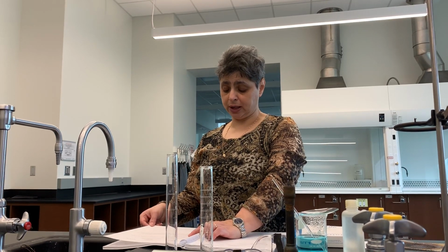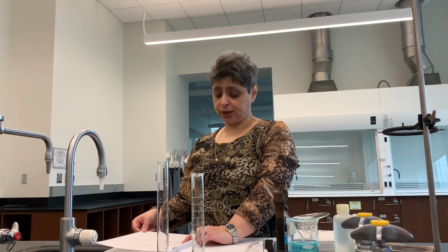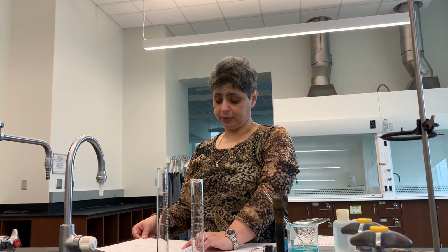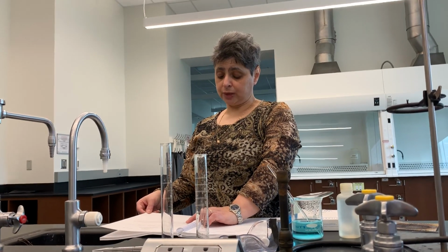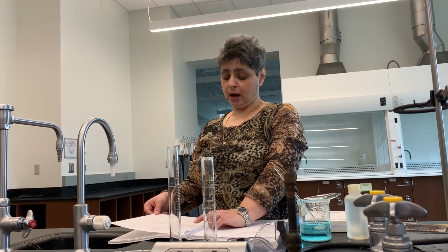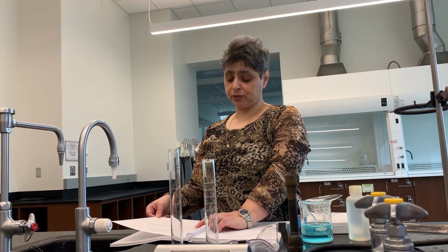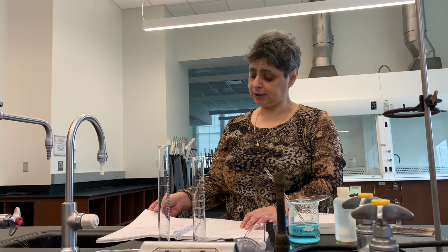So you will have the first entry and entry number 4 on your data sheet. It says weight of barium sulfate. And then you're going to have to calculate percent sulfate in the coordination compound. I'd like to point out that to find the percent of sulfate in the coordination compound, you would have to find the mass of sulfate, and then you would divide it by the mass of purple solid that the experiment was started with. All the numerical values will be provided by your TAs later.